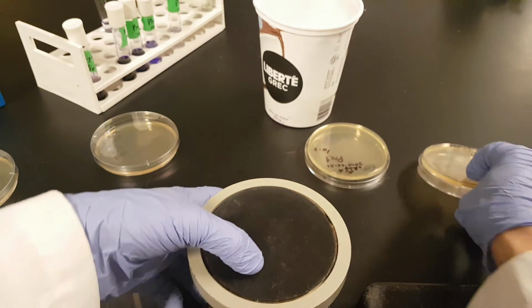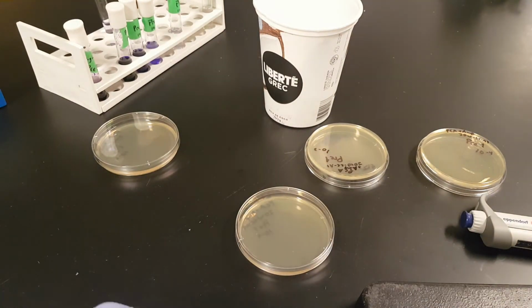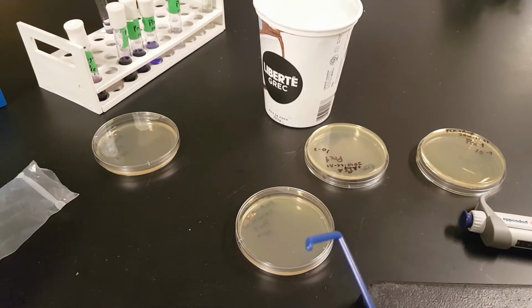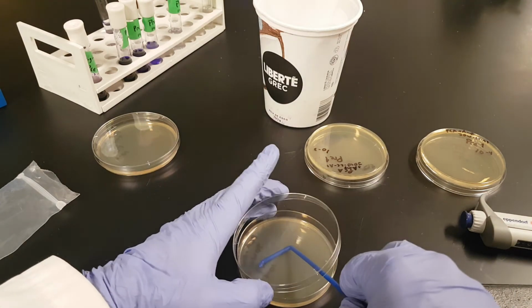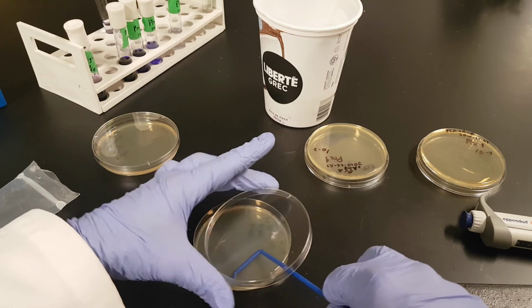Okay, now let's do one without the fancy turntable. This, of course, is a little bit more tedious. What you might want to do is just sort of wait while, if you don't get it, your partner has it, or someone else at the table does. You can wait, but it's not terribly difficult to spread it without. You can do it by hand.